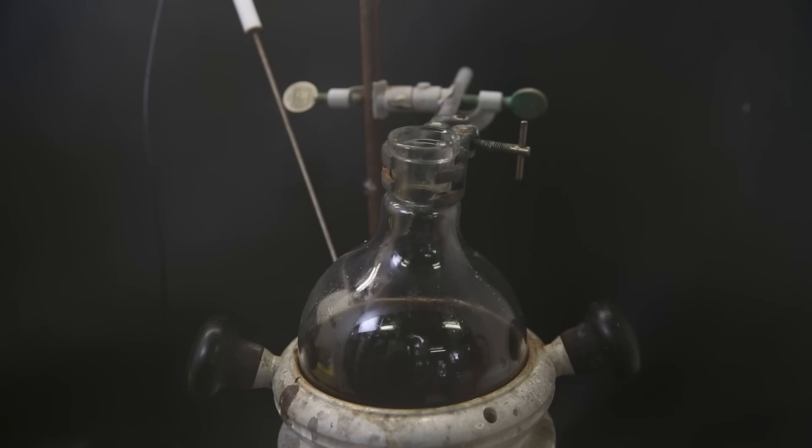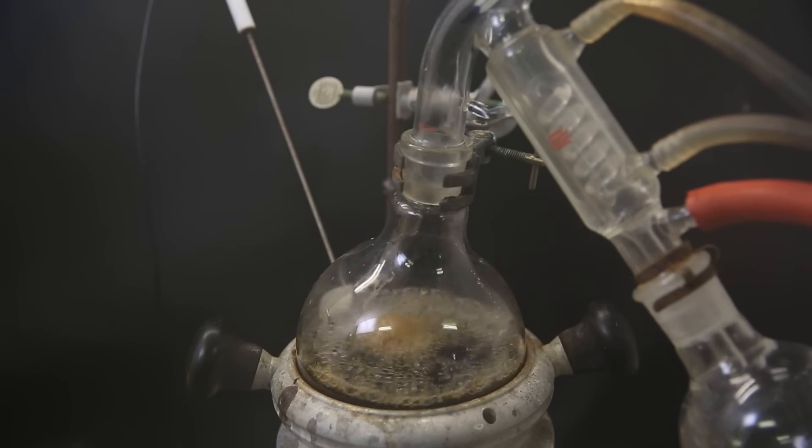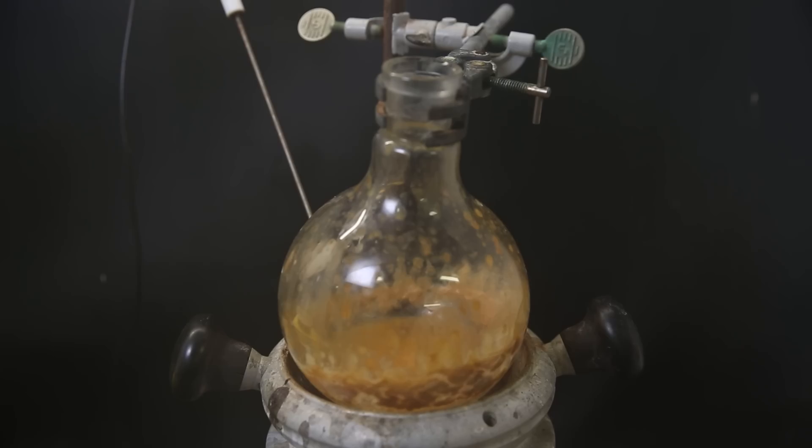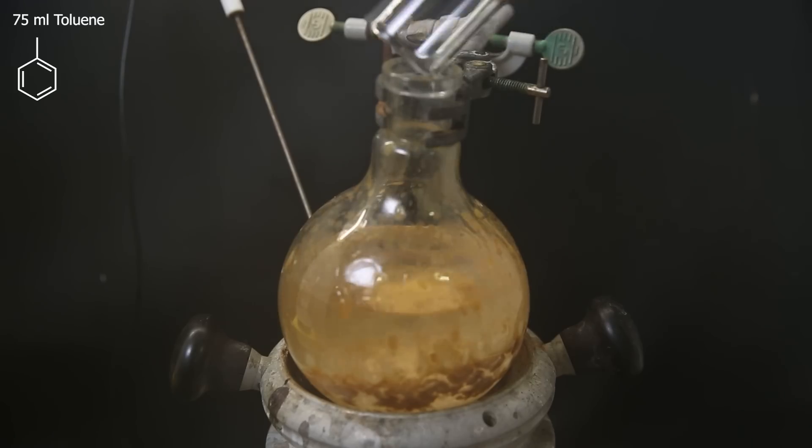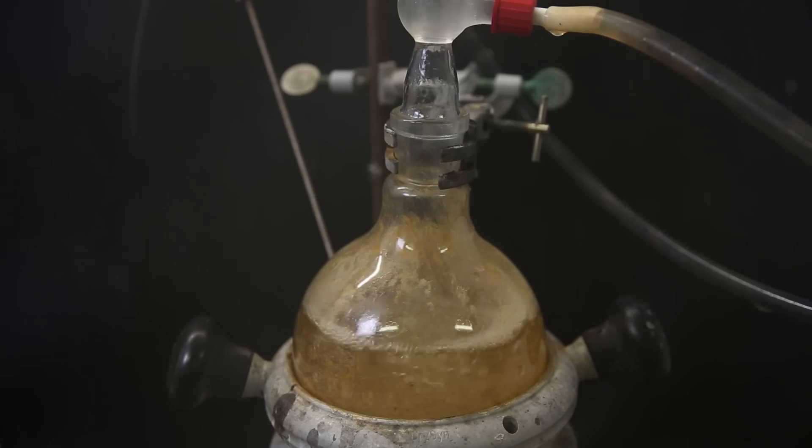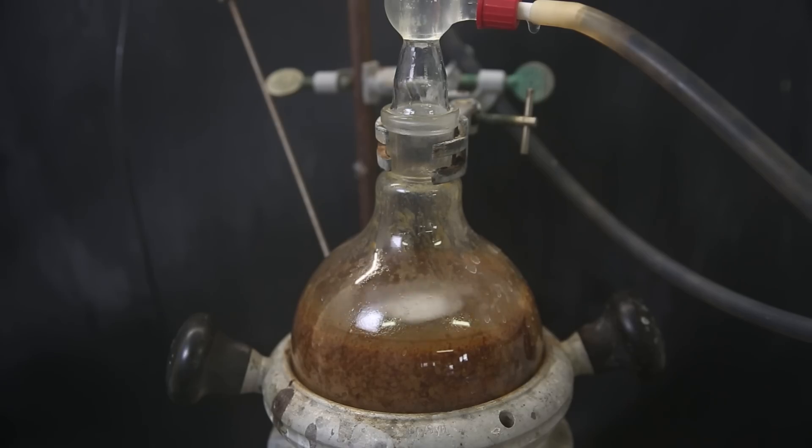So I set it in a heating mantle and start removing all the solvent with short-path vacuum distillation. When it's finished, orange crap is left behind. And to dissolve it, I first add in 590 mls of cyclohexane and 75 mls of toluene, and then reflux this mixture for a few hours. At the end, it seems like it has all dissolved and only the iron crap remains undissolved and kindly sticks to the glass.